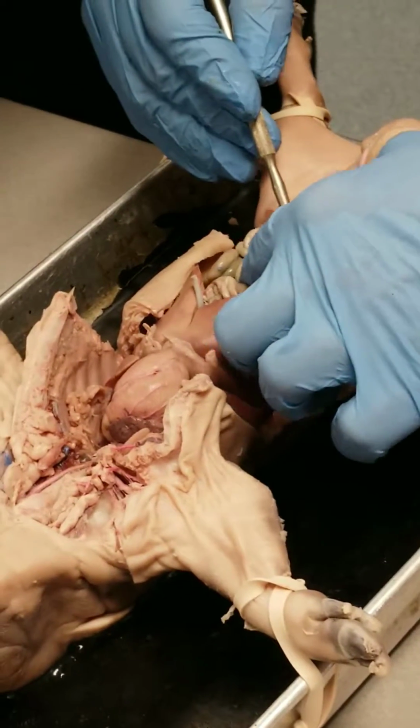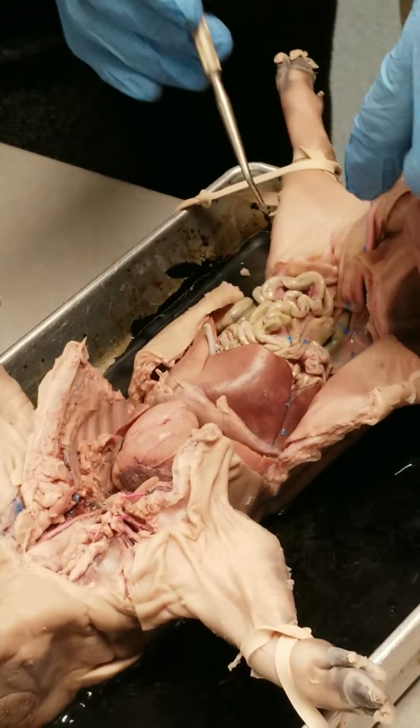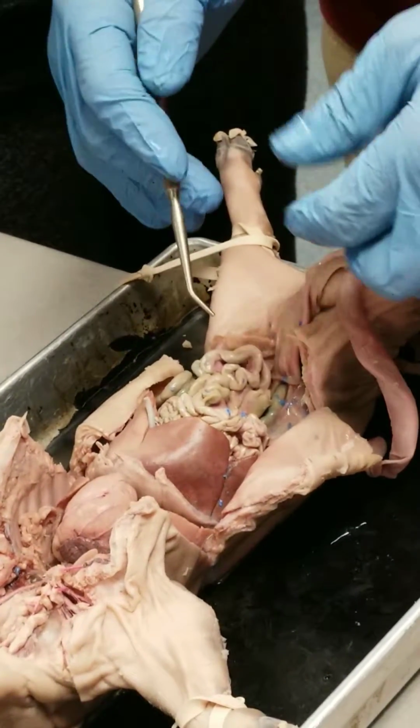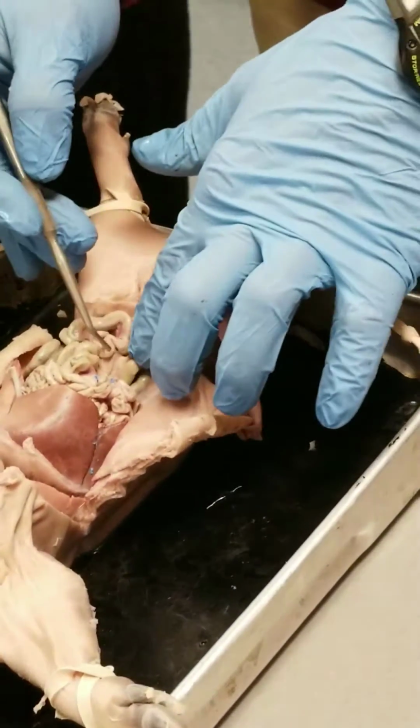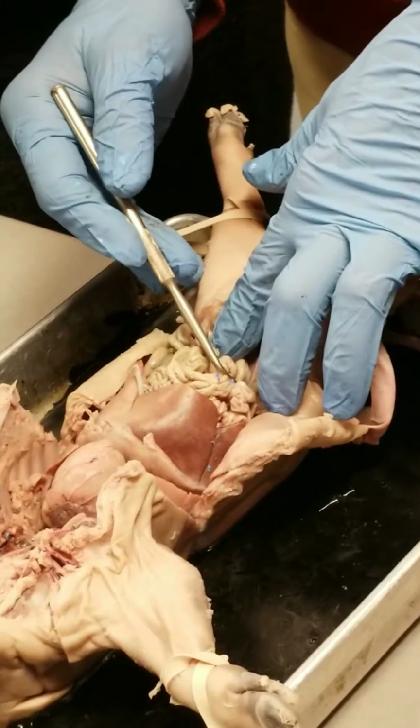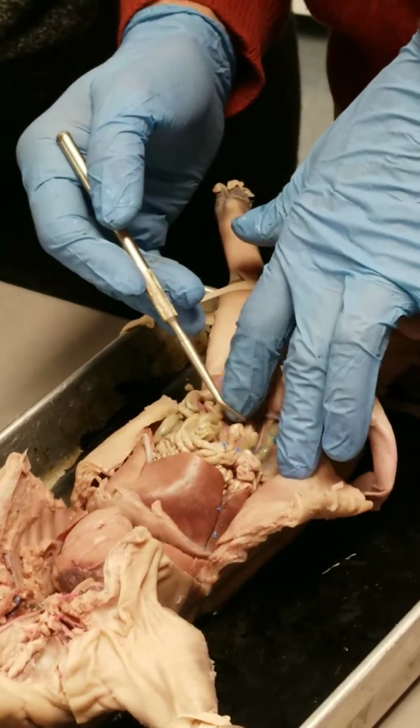The first group to find the appendix in the fetal pig off of the cecum gets $1. They don't pay very much, so I feel generous giving $1. No, I'm joking. Actually, I waited too long to tell that joke because here's the cecum. There's no appendix, so it's a bet I've never lost.